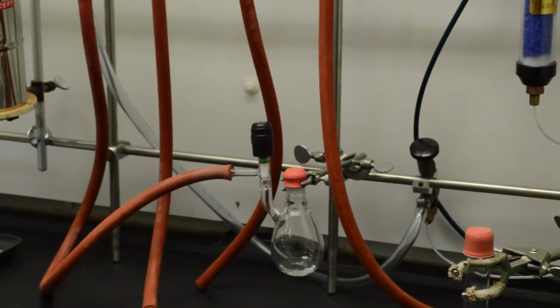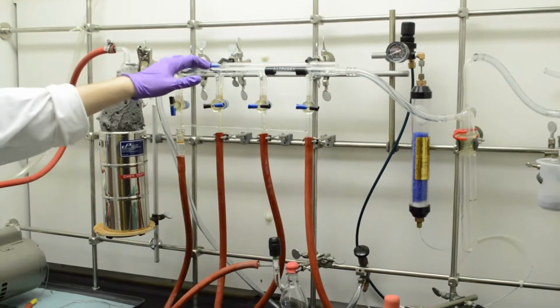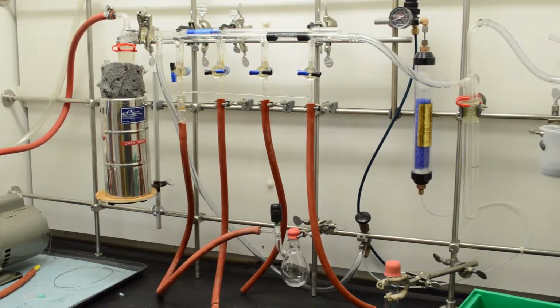And so this will just make sure that there's a constant pressure of nitrogen in here equal to whatever the pressure is in this system. And then you can just let your reactions stir for however long you need to. And by the time that these are done, it'll be air safe.